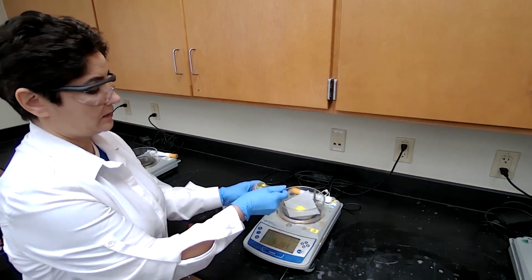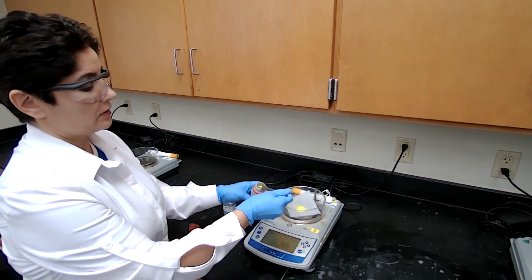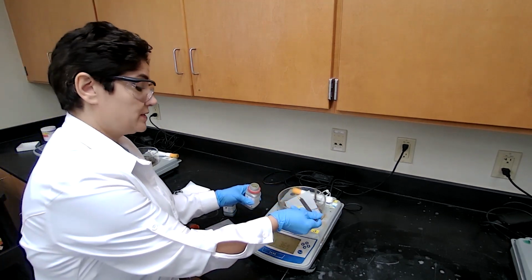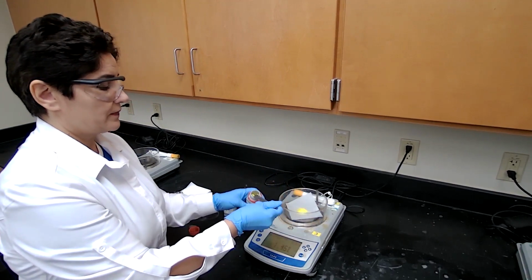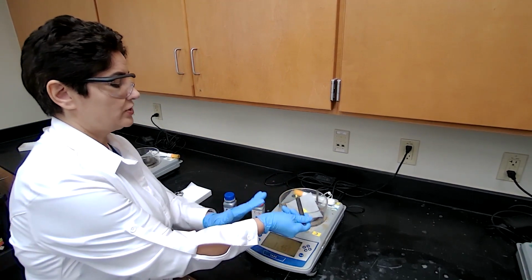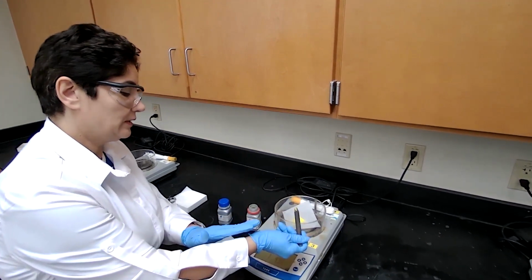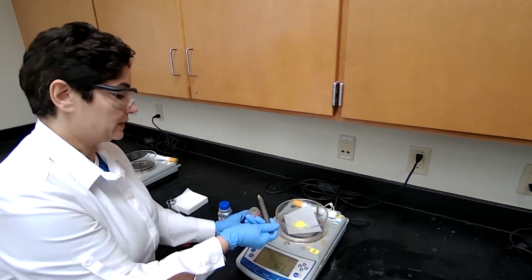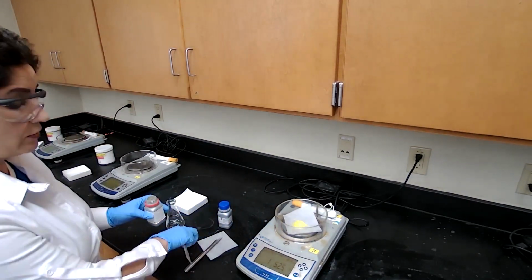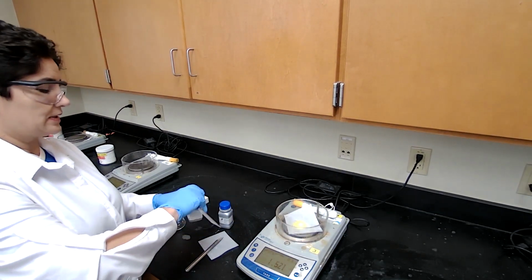Fluorenone, as I said, and you could see, is a yellow color. The product of the fluorenone, which is the secondary alcohol, is going to be white. So completion of this reaction is evident by a color change. When the yellow color disappears completely and the white color appears, that means the reaction is done.